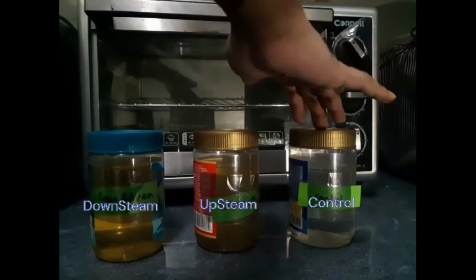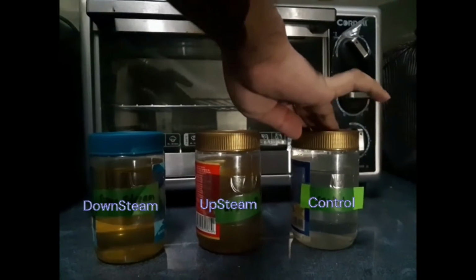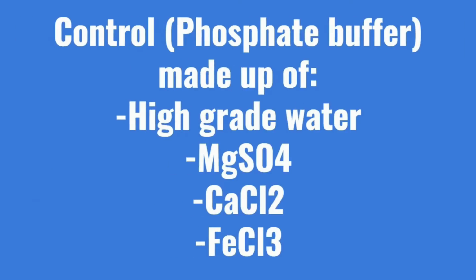Three bottles will be used. One will contain a sample from downstream of the river, one will contain a sample from upstream of the river, and another one will be a control. The control is a solution mixed from high-grade water that doesn't have copper or chlorine, magnesium sulfate, calcium chloride, and iron(III) chloride solution, which is essentially a phosphate buffer solution.